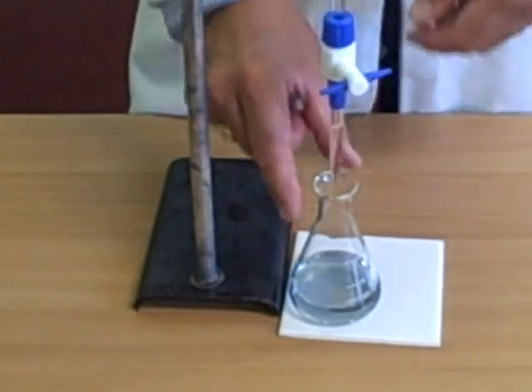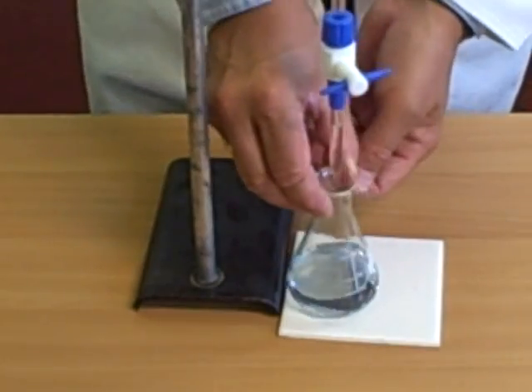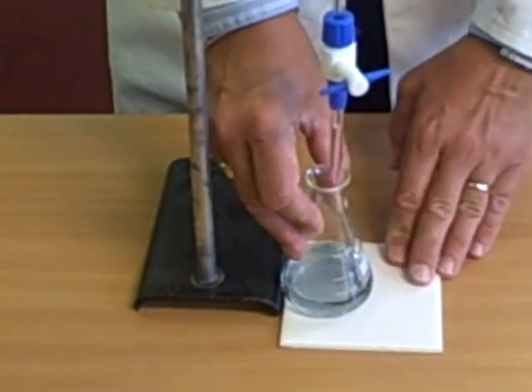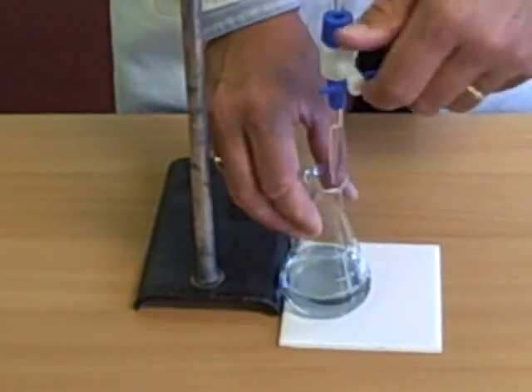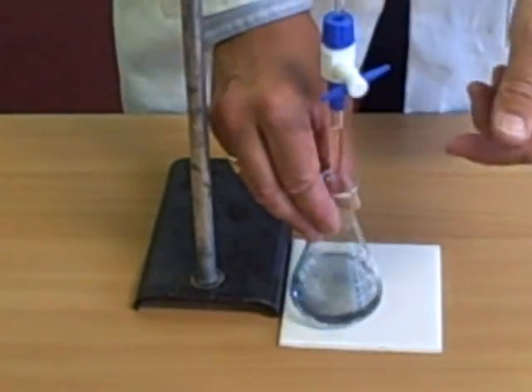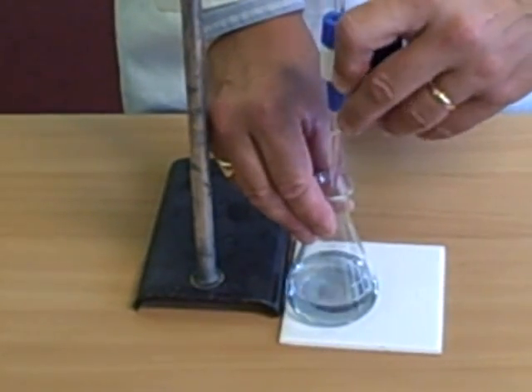While you're doing this, of course, you will be wearing your lab coat, but more importantly, you will be wearing your goggles. When there is a colour change, the white tile shows it up even more. One, two, three, swirl. This is my rough example.